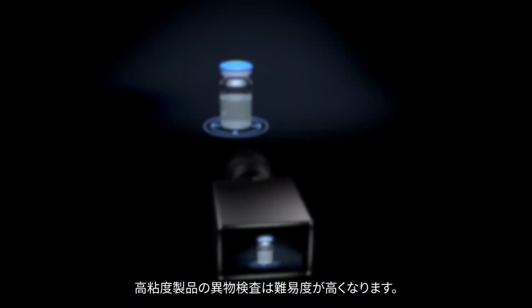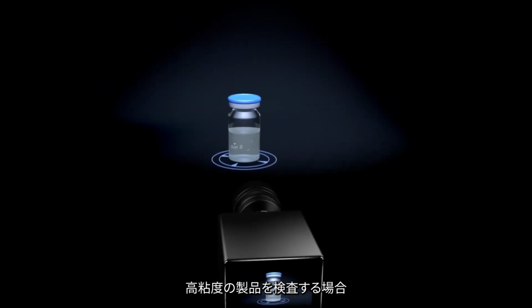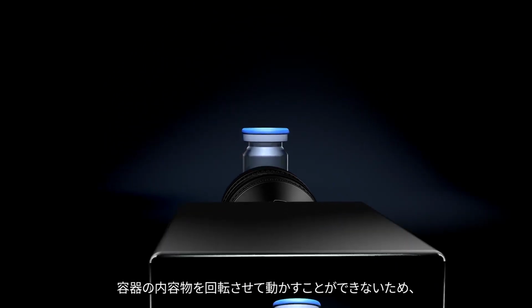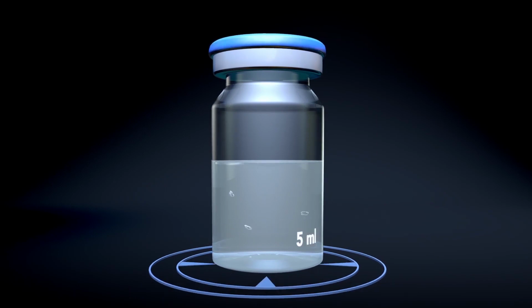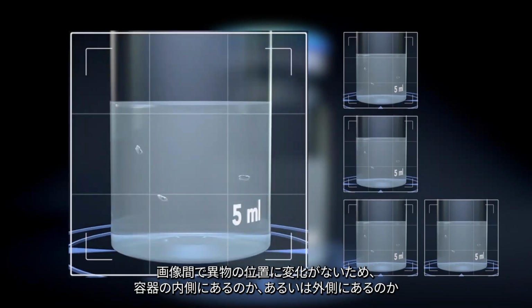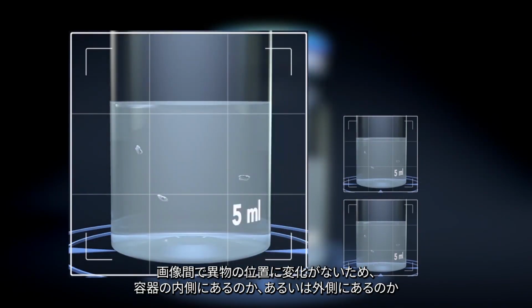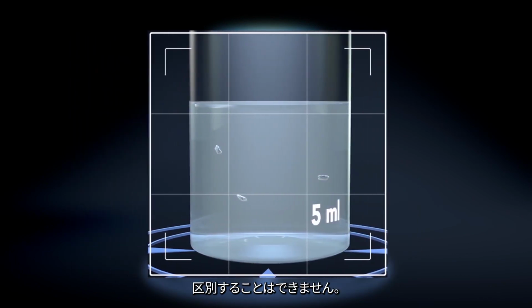The challenge: particle inspection for highly viscous products. When inspecting highly viscous products, the described inspection method produces no results, since the contents of the container cannot be set in motion by rotation. Since there are no changes in particle position between the images, impurities inside the container cannot be differentiated from those on the outside.